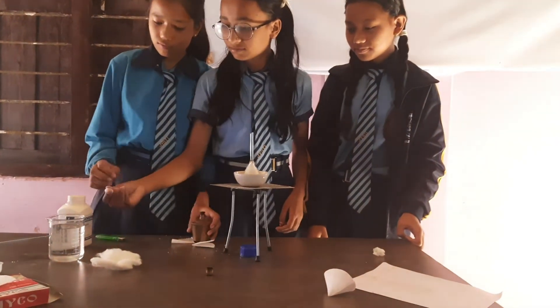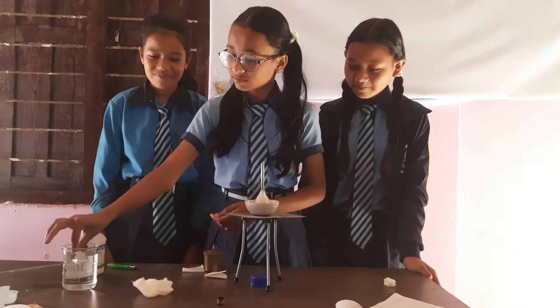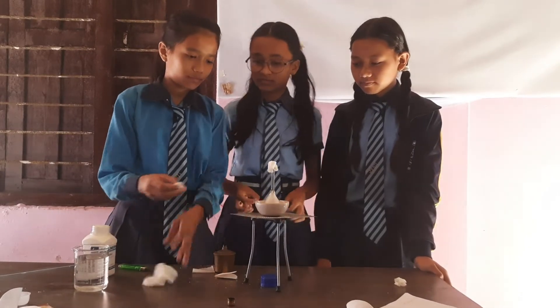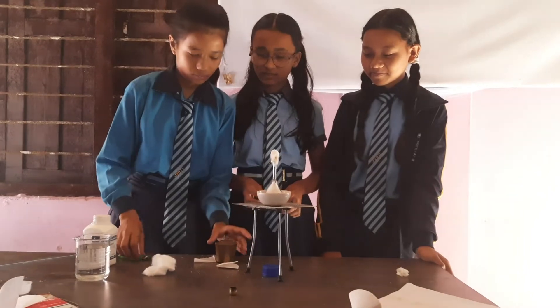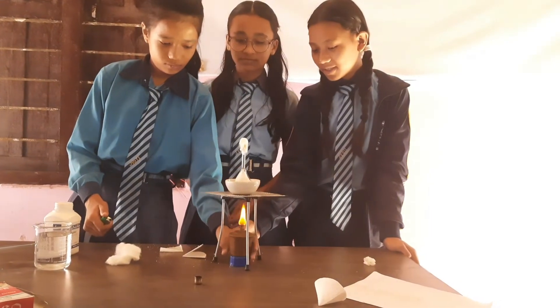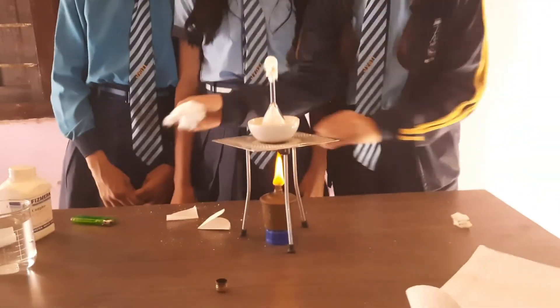Use the white cotton first of all. Put it in the middle also. Now put some amount of cotton here as well — yes, white cotton.